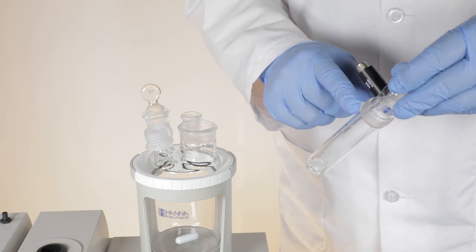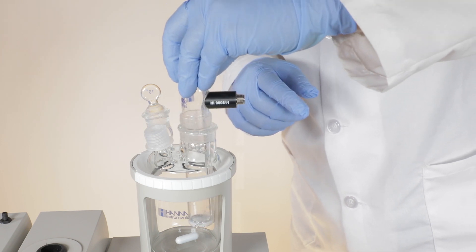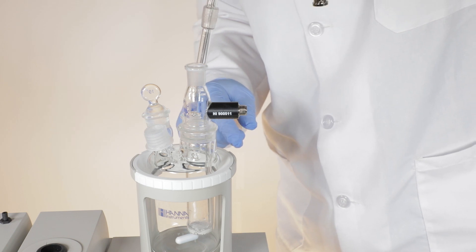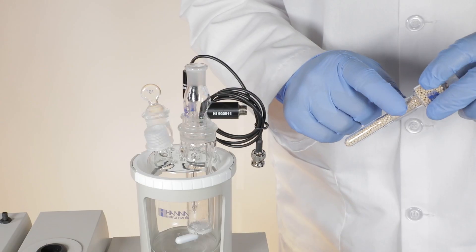Be careful when inserting the generator electrode that the mesh on the tip doesn't hit the side of the port when inserting. After placing the electrodes and the reagent exchange plug, insert the ground glass desiccant tube into the top.